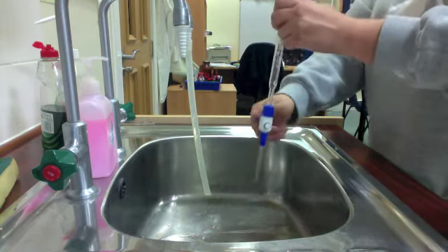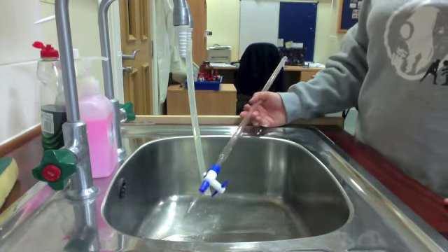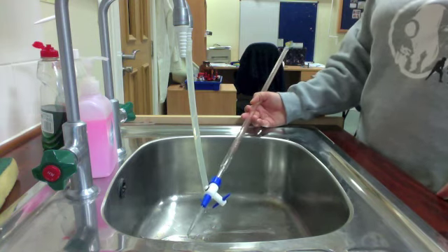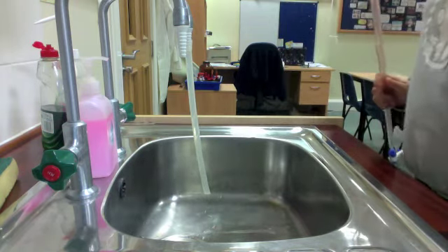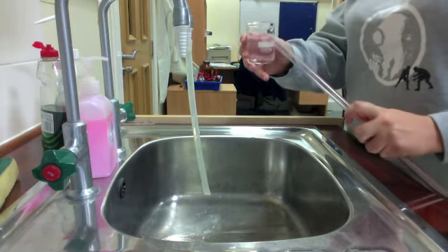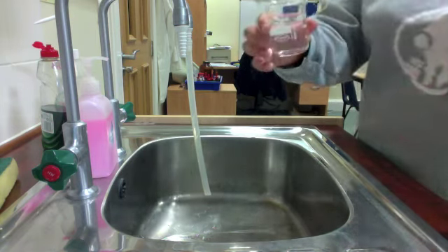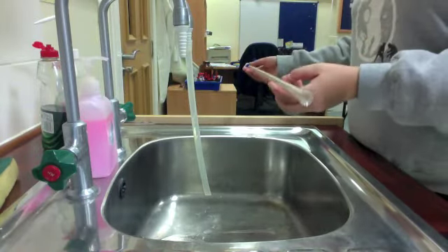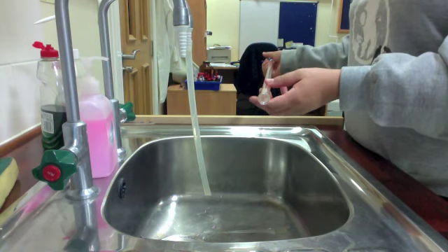Now, the small problem is that my burette is wet, and any water left behind is going to dilute the concentration of my sodium hydroxide. So to continue prepping the burette, I then take some of my titrant, in this case sodium hydroxide, and do that same process that I did with the distilled water. So I'm just pouring in maybe 10 to 15 mLs and rotating it so that it can hit all the walls of the glass.